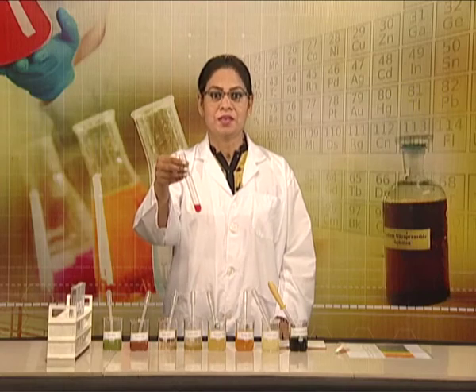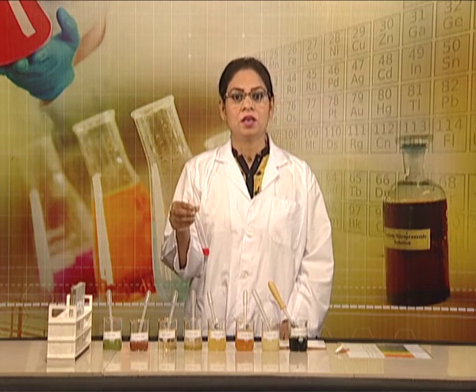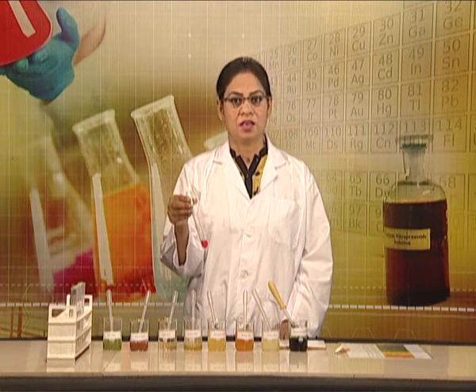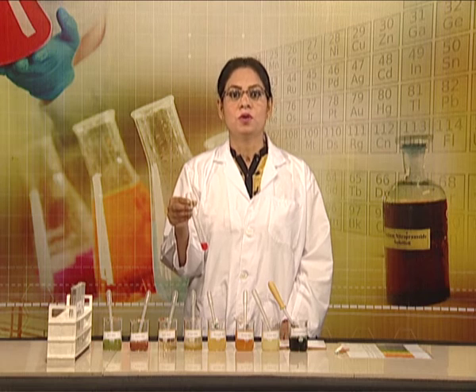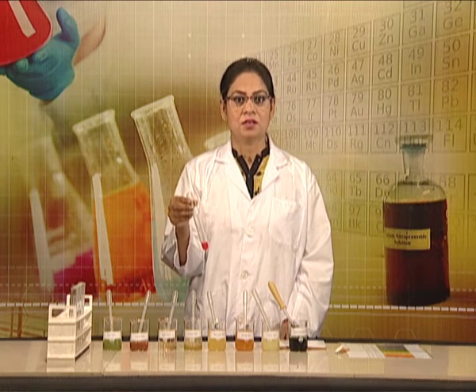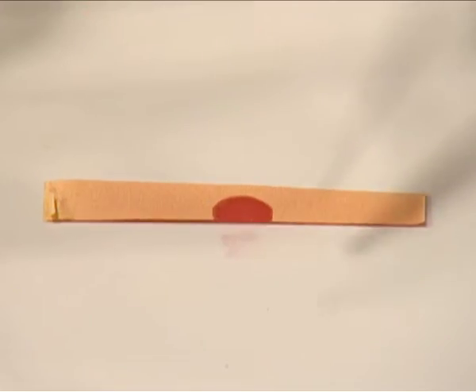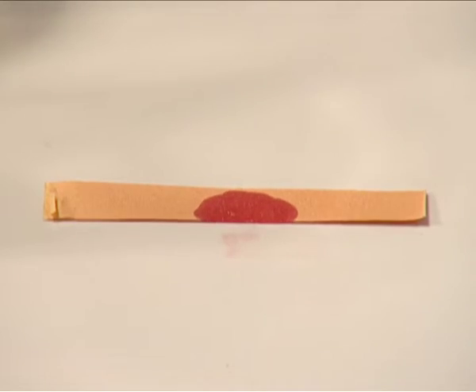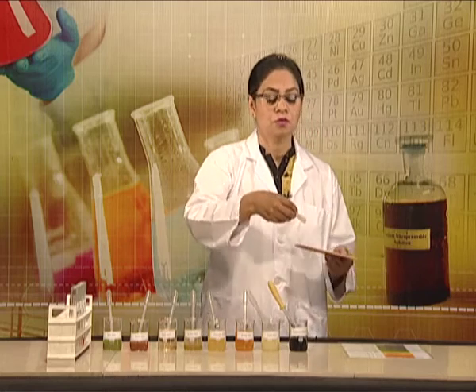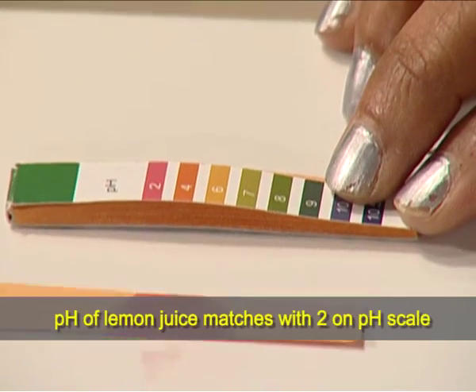Since the expected pH range of lemon juice is from 2 to 3, we cannot determine its pH from universal indicator, whose range is from 4 to 11. Let us try pH paper in this case. As you can see, it shows red color, which matches with the pH 2 in case of lemon.